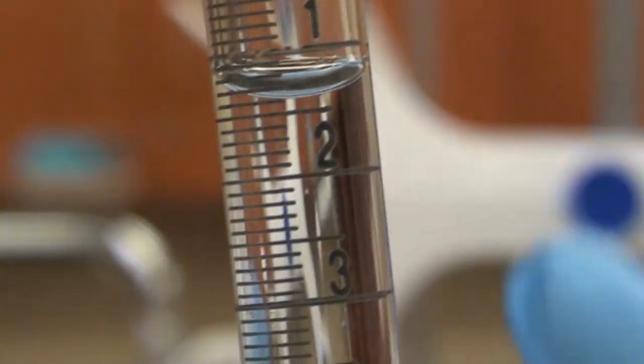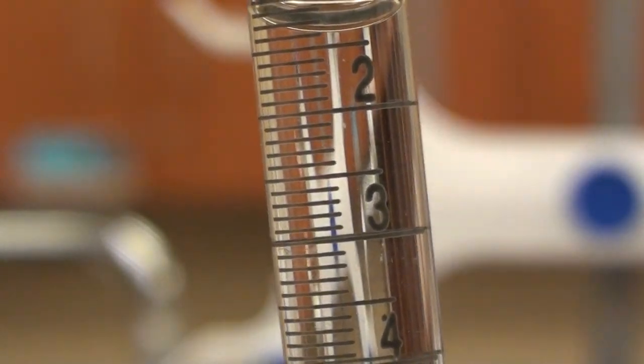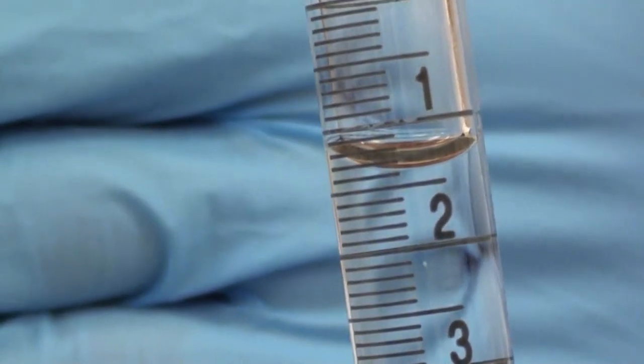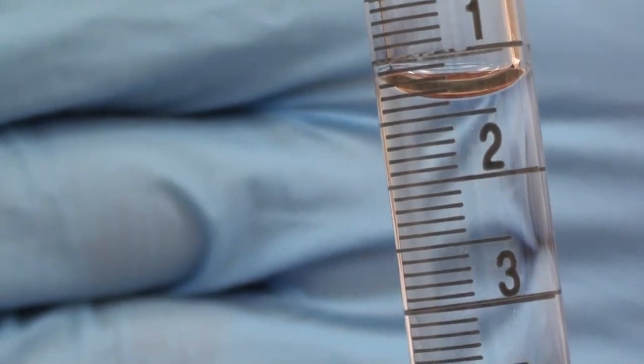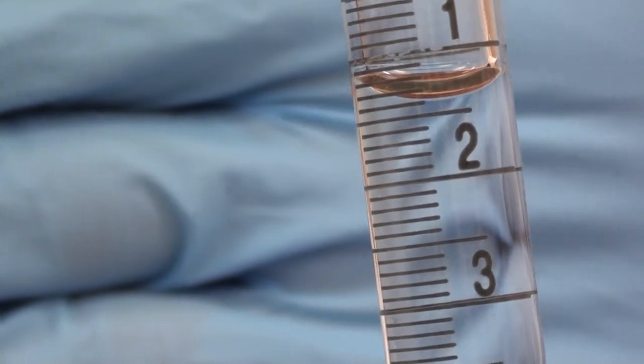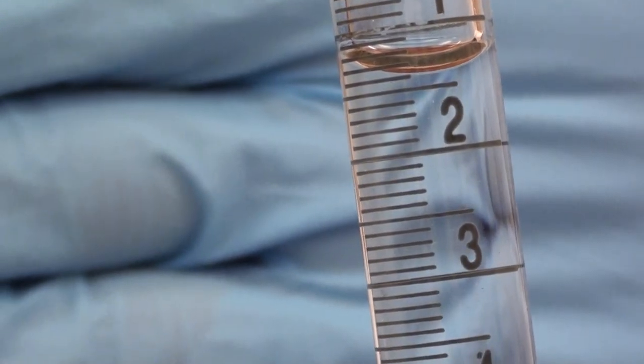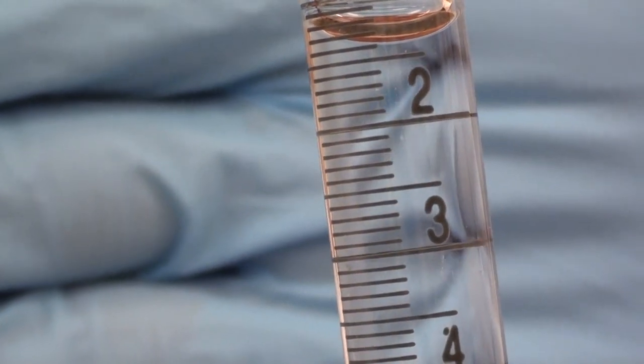And I'm going to try and pull this in here and show you what the measurement looks like. You can see there's our measurement here. It's between 1 and 2. You'll notice it numbers downwards because we're measuring empty space here. And you can see here that it's between 1 and 2 and it looks like it's on about between the 3rd and the 4th line is what I would say. So I would measure that as being 1.35.